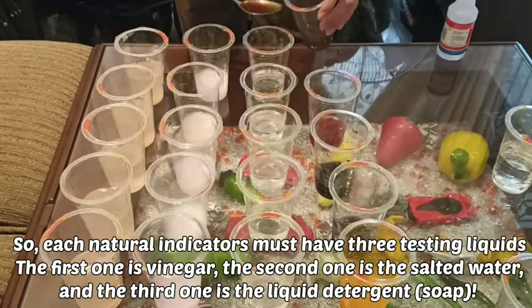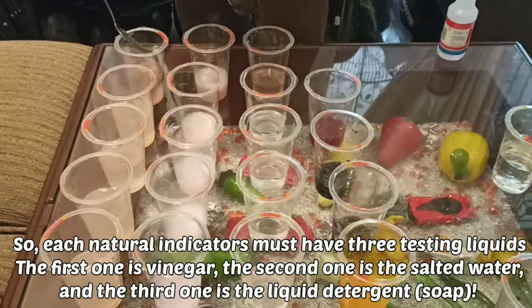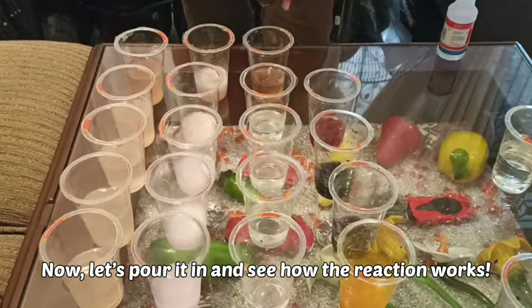The first one is vinegar. The second one is the salt water, and the third one is the liquid detergent or soap. Now, let's pour it and see how the reaction works.